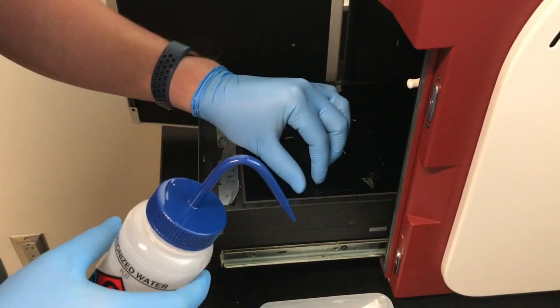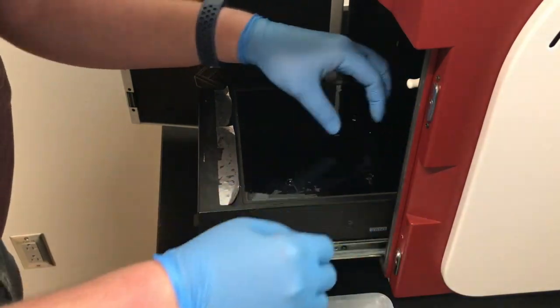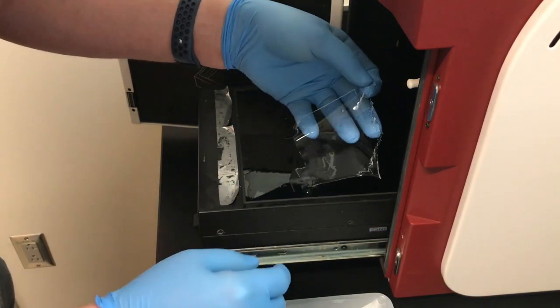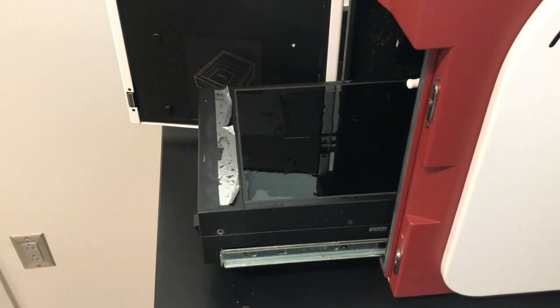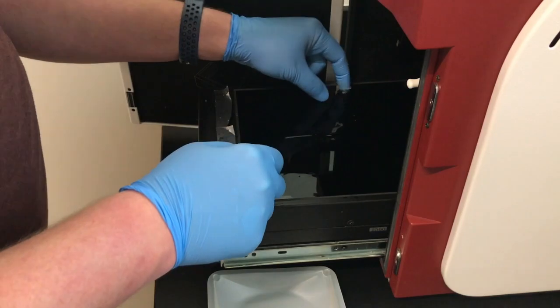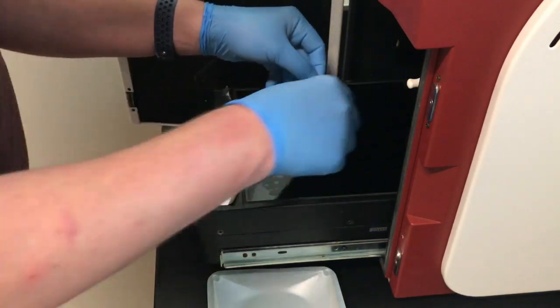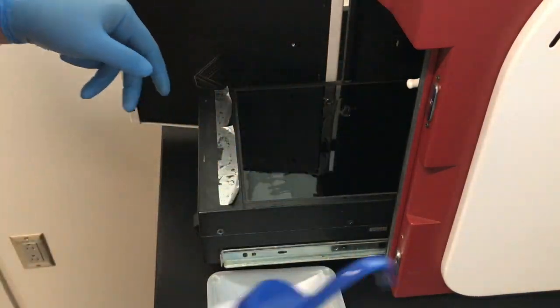After imaging, we're going to need to get the gels back in order to do western blot on them. Again, the TA will do this because this is a very delicate process. I'm just ever so carefully using a little bit of water in order to get the gels out of the imager and into some weigh boats.